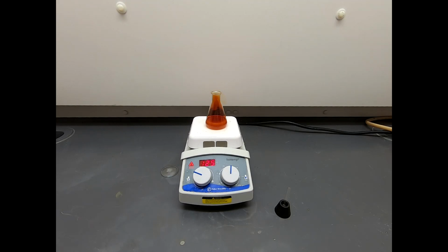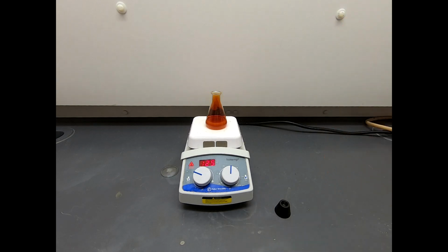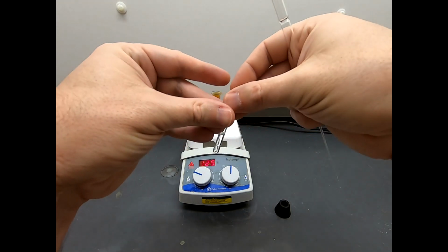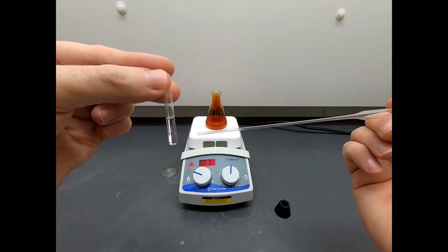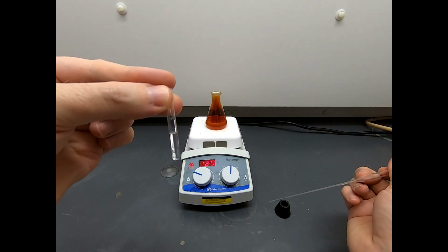Okay, I want to say one more thing about this 3-lane TLC plate. So we're going to sample the material out of here, and this uses a technique I call a mini workup. I don't know what other people call it, but I have a little test tube here. And this test tube, I'm not sure if you can see, but there's a lower layer that's just water, and the top layer is ethyl acetate.